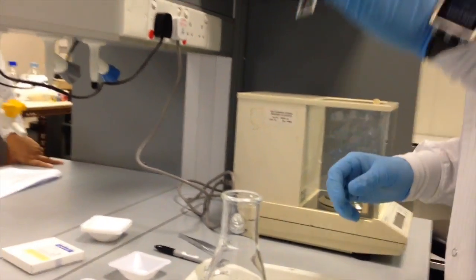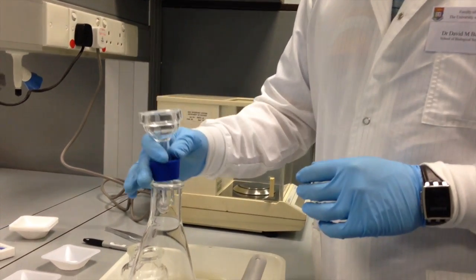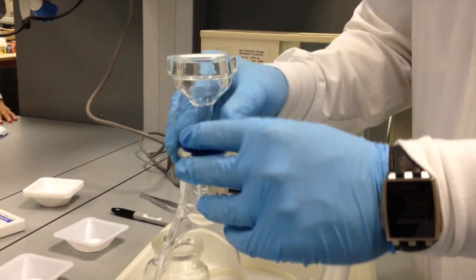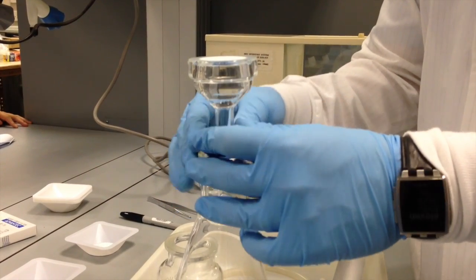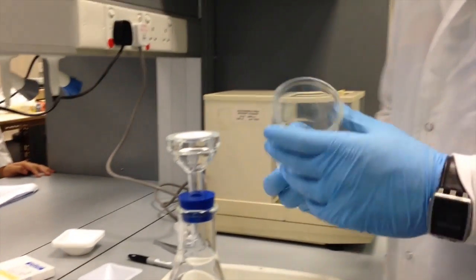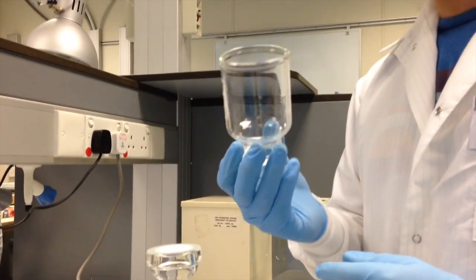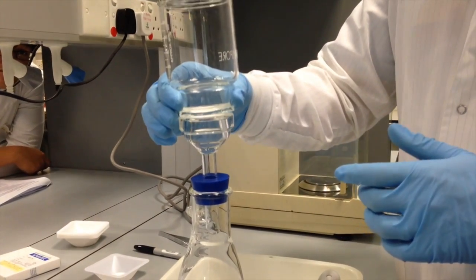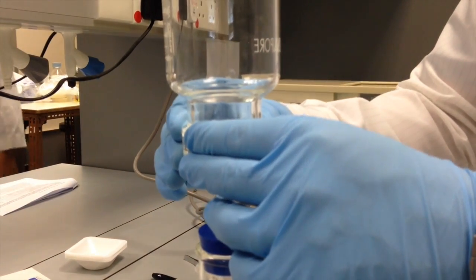Okay? So this piece has a silicone stopper which can be fit perfectly into the top of the Erlenmeyer flask. We don't even have to press too hard, because when we apply the vacuum, it will be seated into that union. The next piece we have is a funnel, and the funnel can hold about 300 milliliters of solution. And the funnel has a nice ground glass surface that forms a nice seal, especially when wet, above the fritted glass filter.